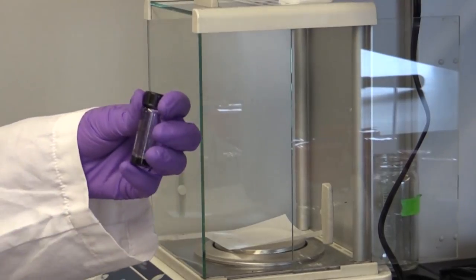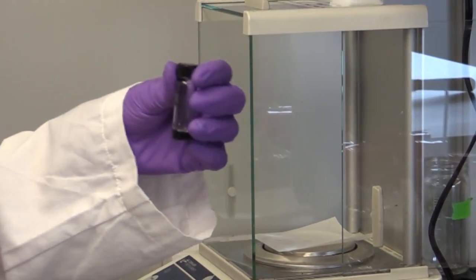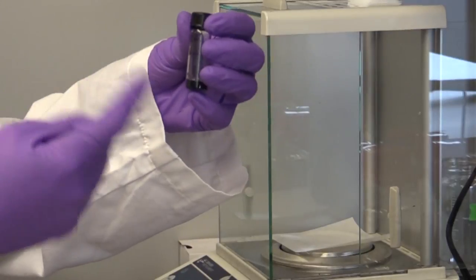After that, we just drop the magnet and put it on the stirring base overnight to stir so that it will give us good homogeneity.